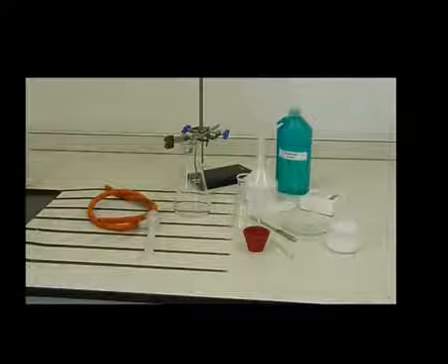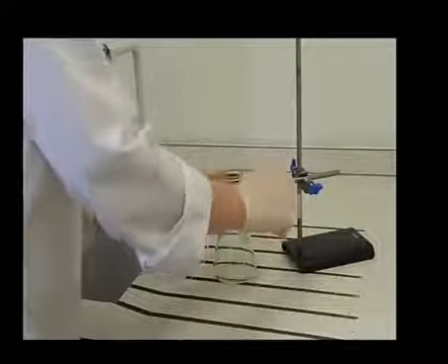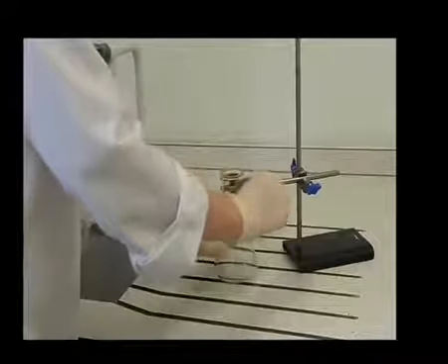This is the equipment we will be using for performing our Buchner filtration. Set up the Buchner flask by clamping it securely at the neck.